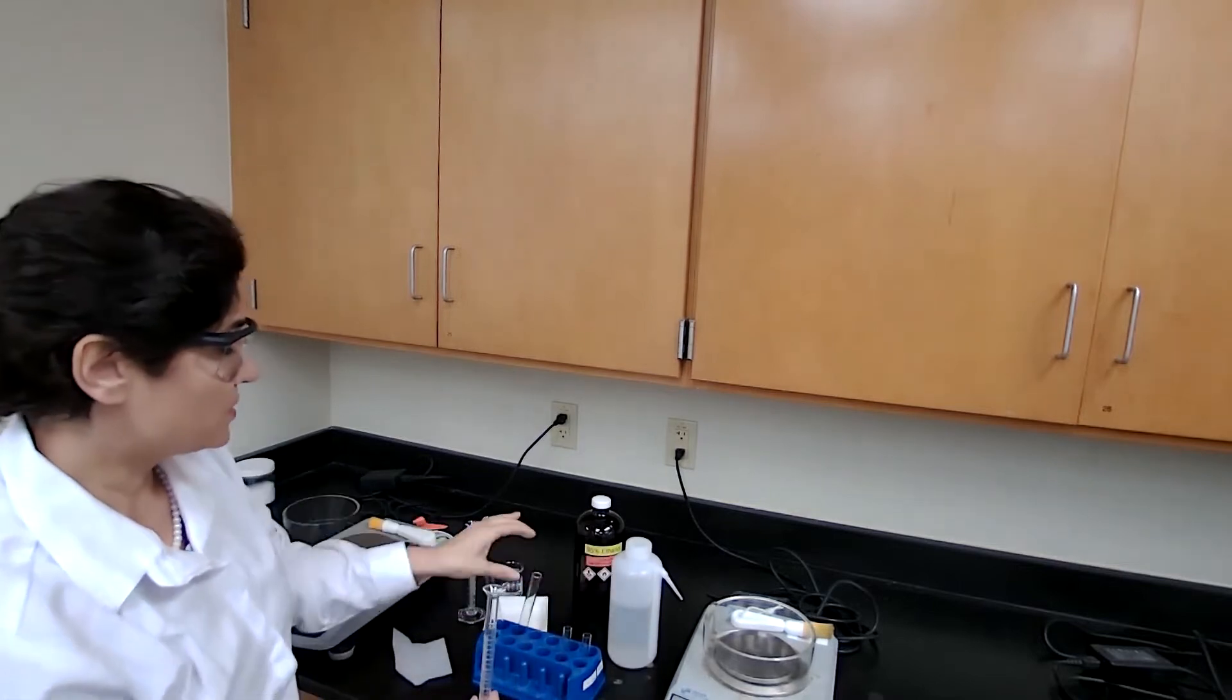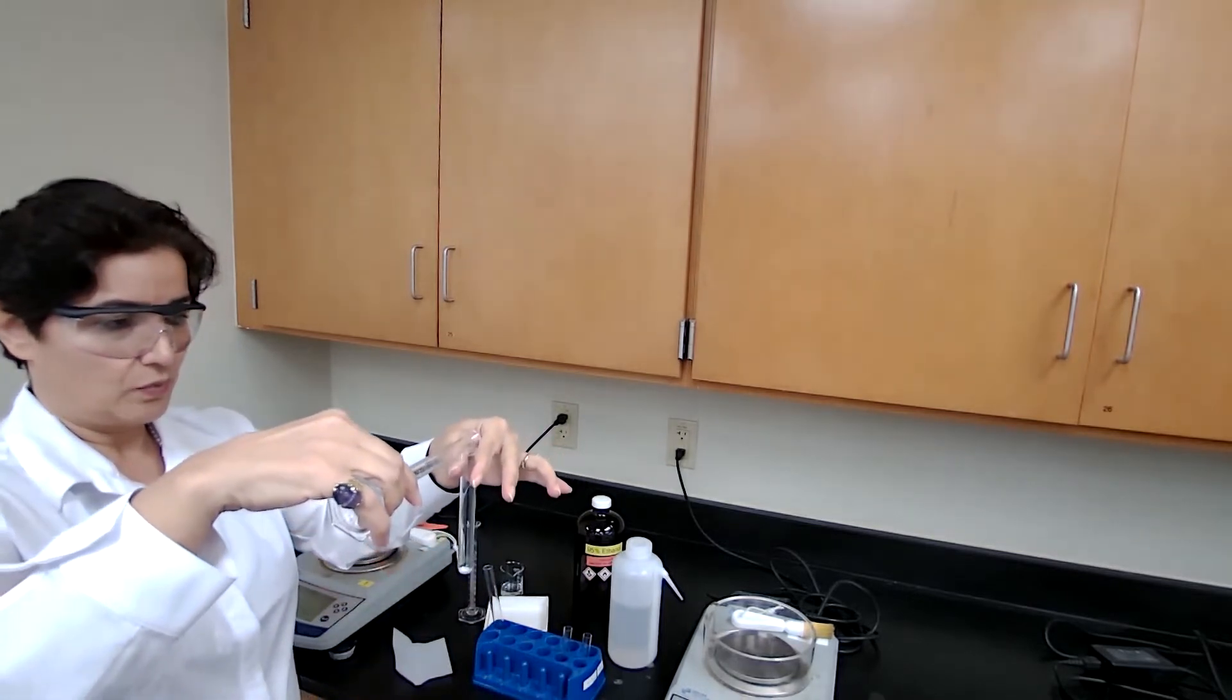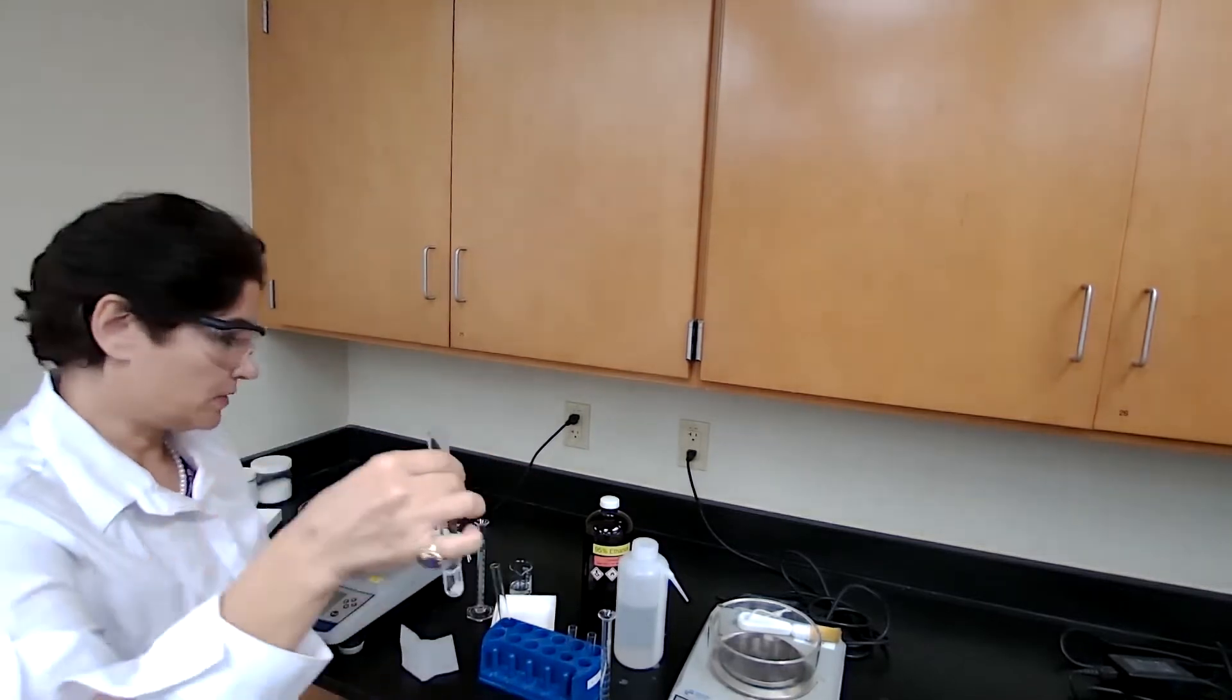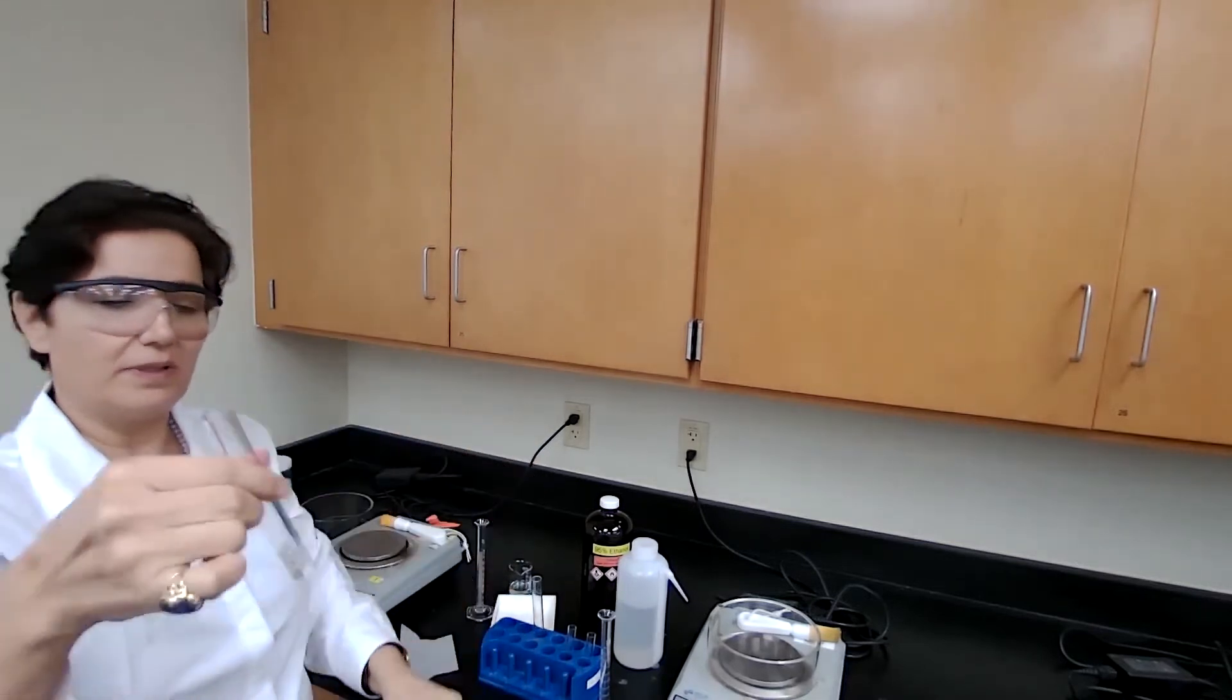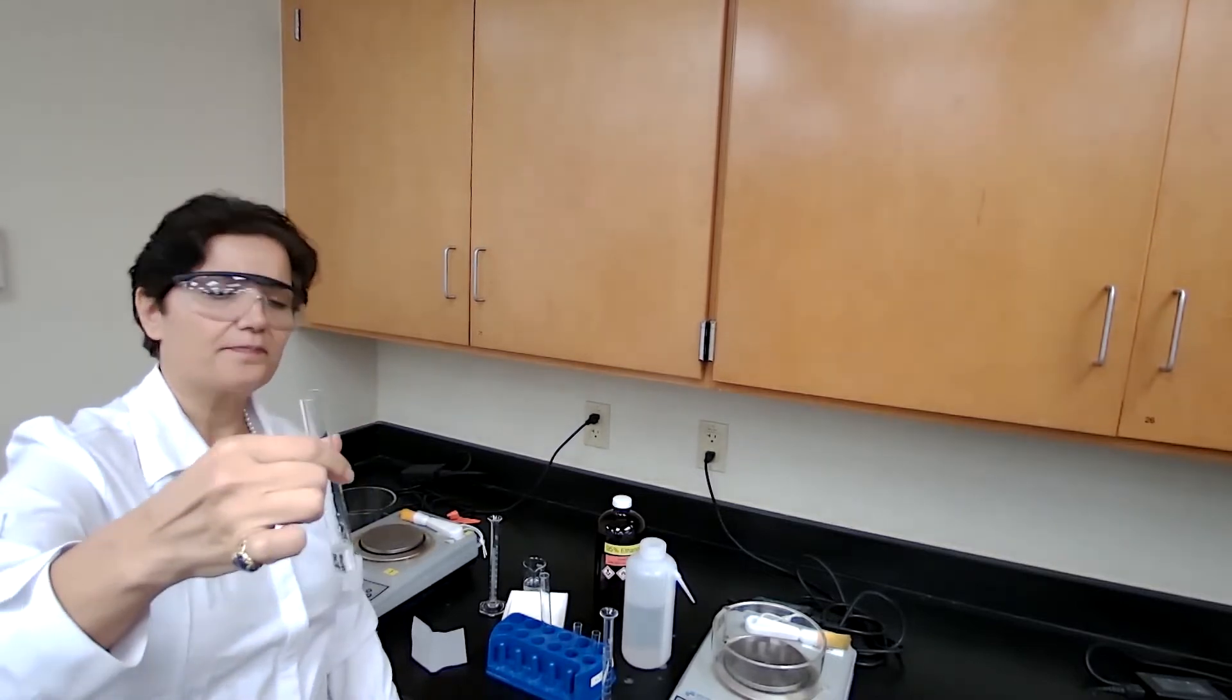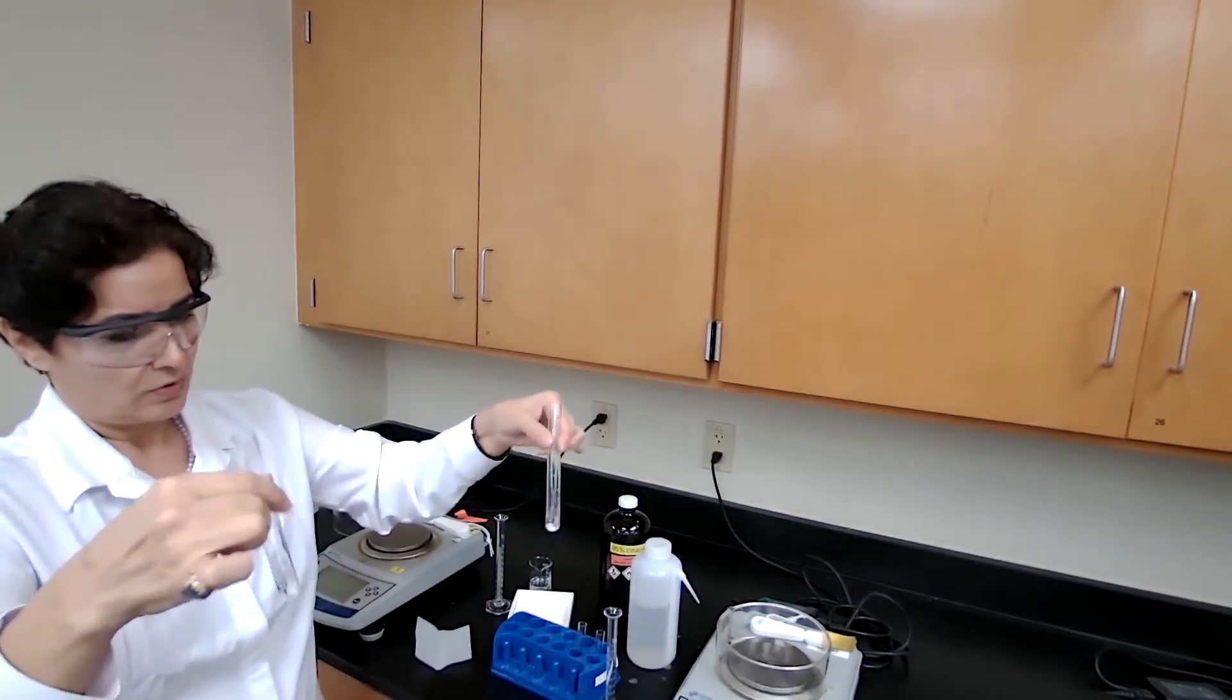If it dissolves at room temperature, it's not good. This test tube has deionized water - three milliliters of water plus 0.1 grams of the sample. The other test tube has three milliliters of ethanol with 0.1 gram of the sample. I'm going to shake both and agitate to see if they dissolve at room temperature.